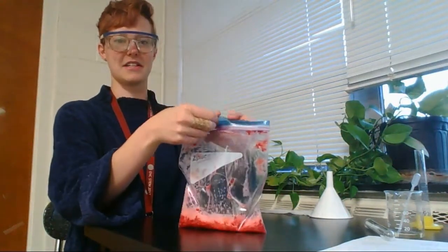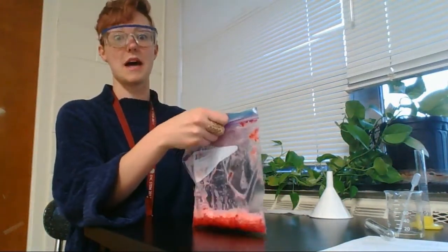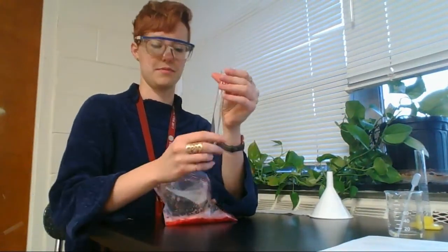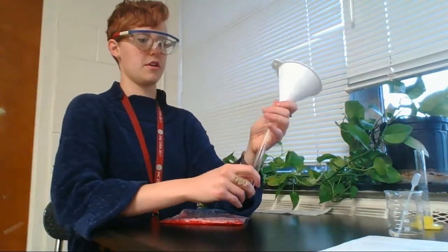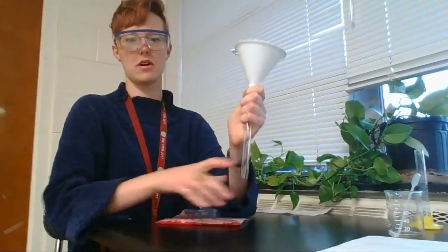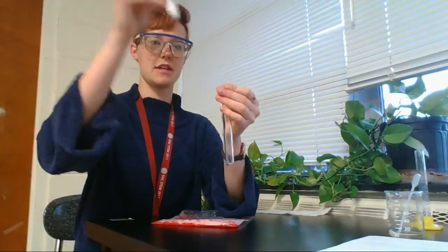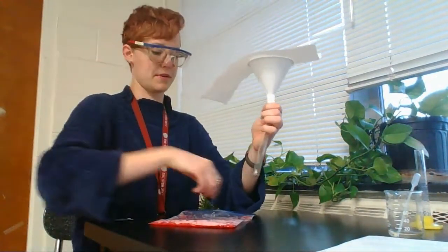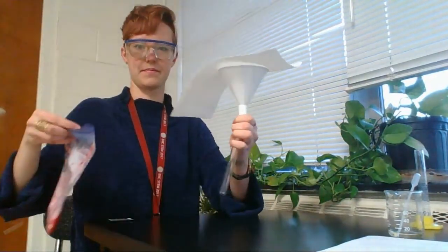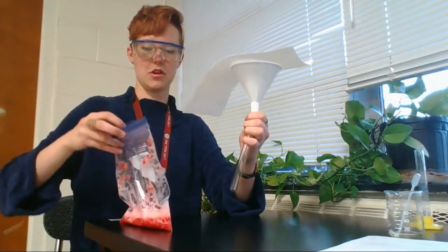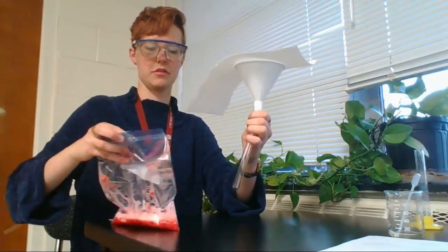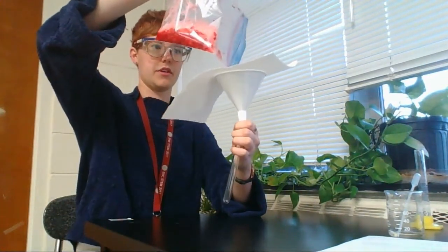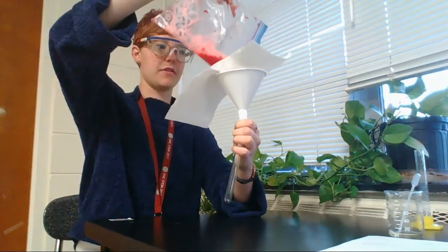Next up, and it's going to get a little tricky for me here because I don't have a partner. You're going to take your test tube, you're going to put your funnel on top and make sure that the end of the funnel is going into the opening of the test tube. You're going to place your paper towel on top of that. Then, you are going to pour the contents of your Ziploc bag on top of the funnel.